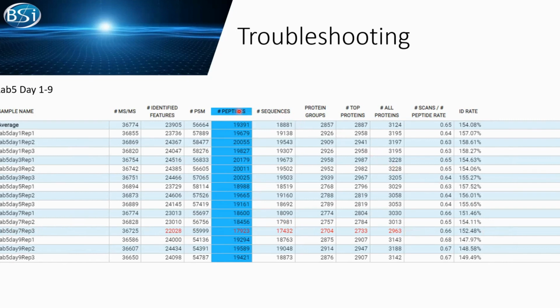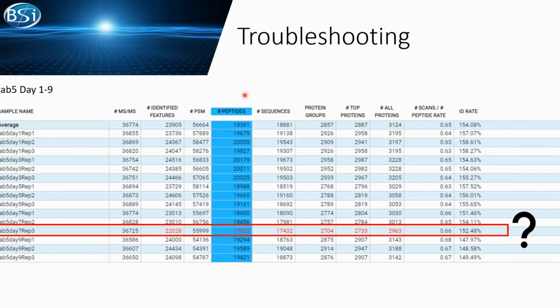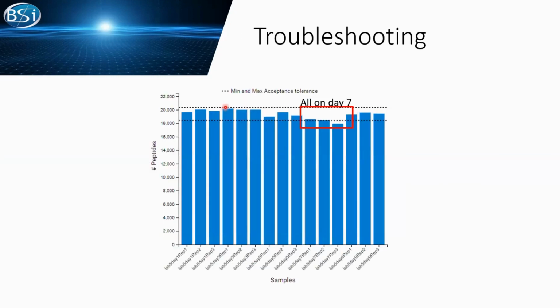Now, we can plot some attributes into a line chart. We can take a direct view. So in DDA, we are plotting this into some bar charts. Now we can see I have low peptide numbers on all my day 7 runs. Even besides one of my runs being below the threshold, 2 other runs just barely meet the threshold. So it looks like there's something wrong in my day 7 runs.